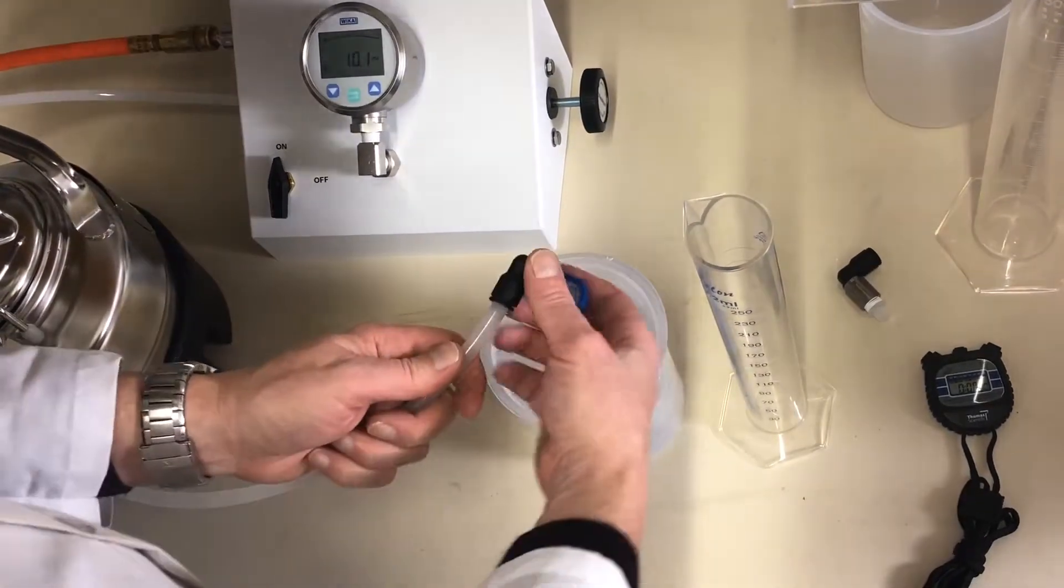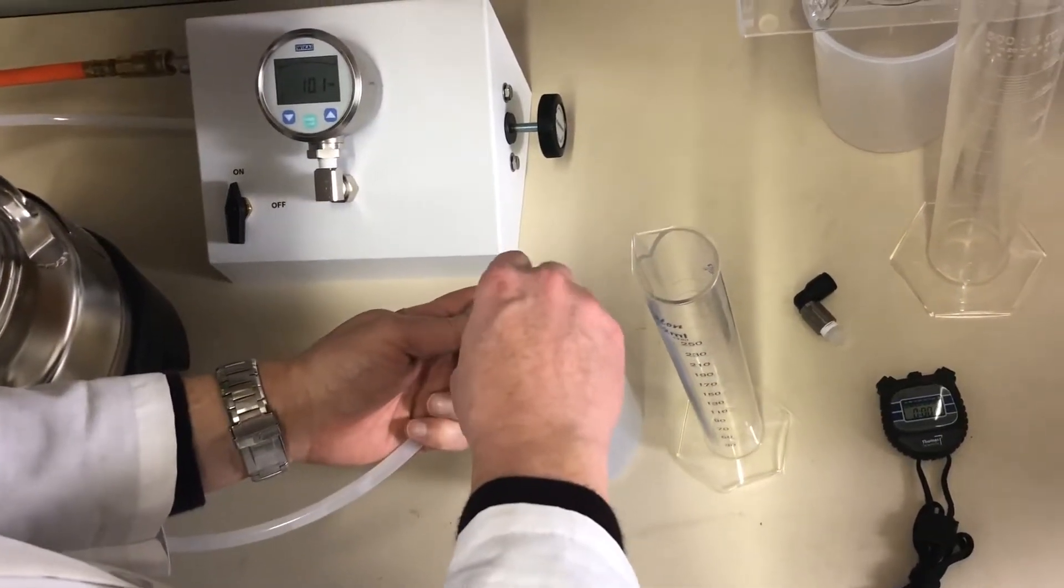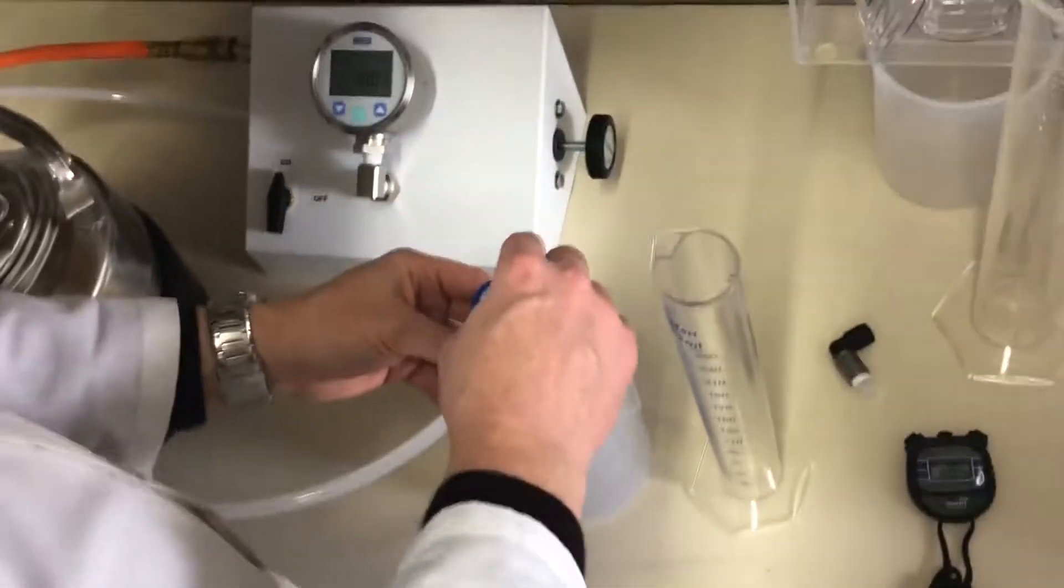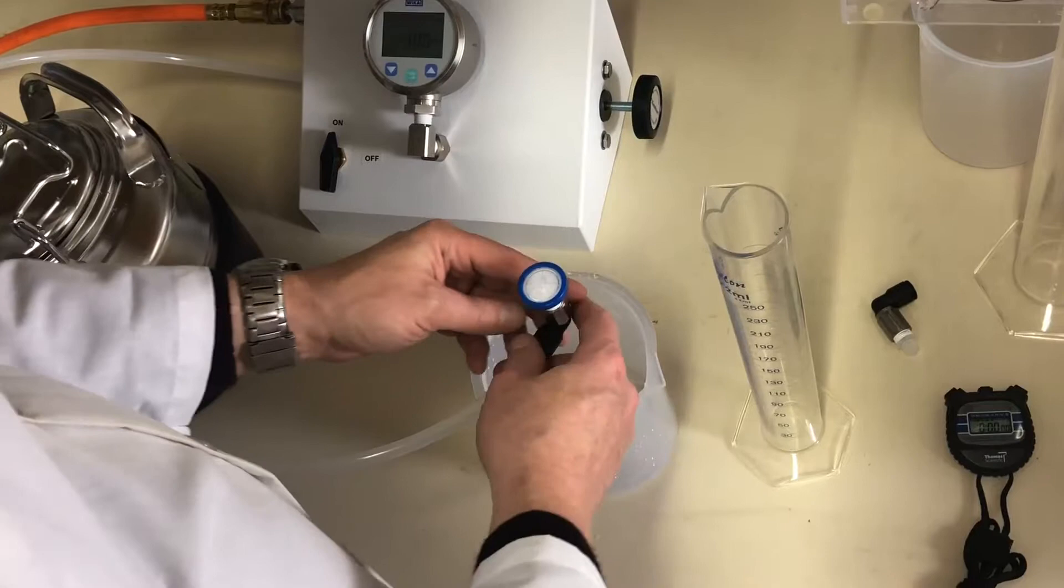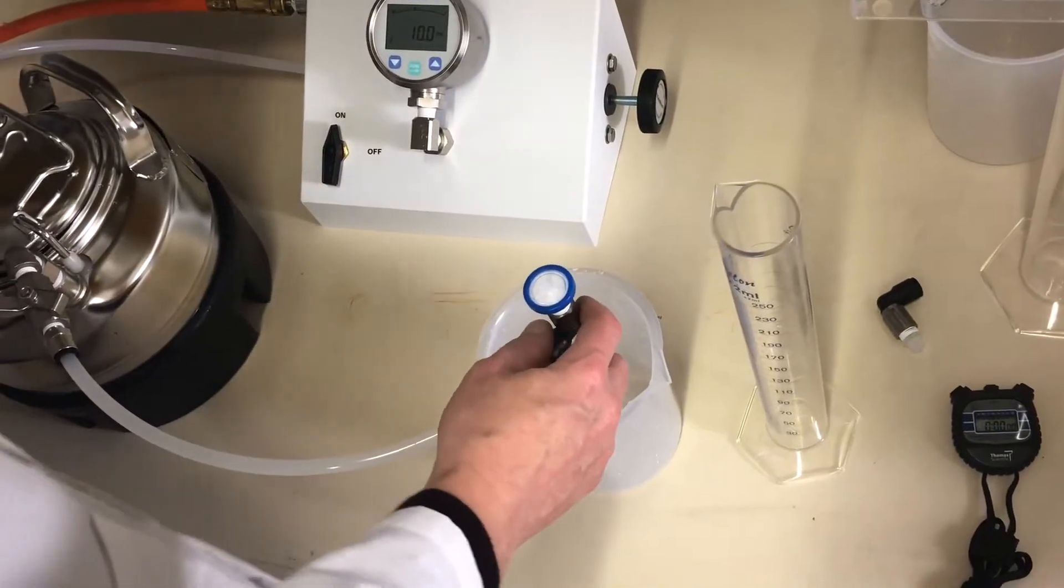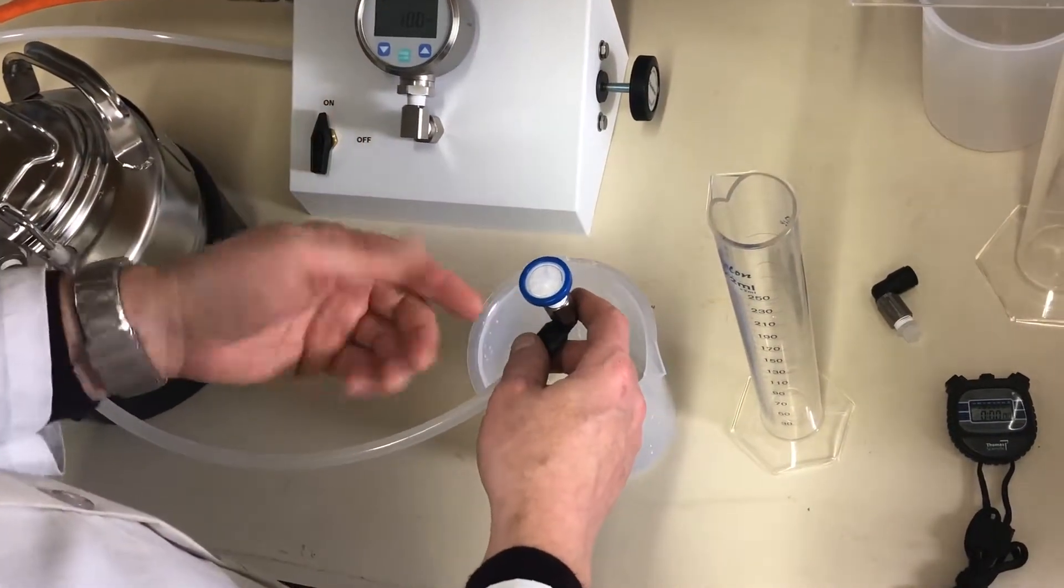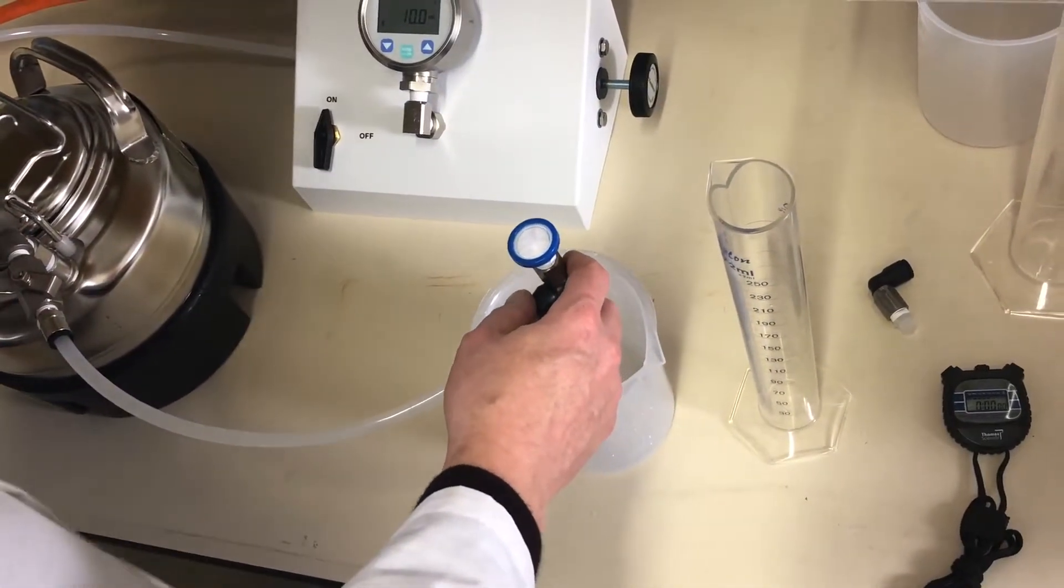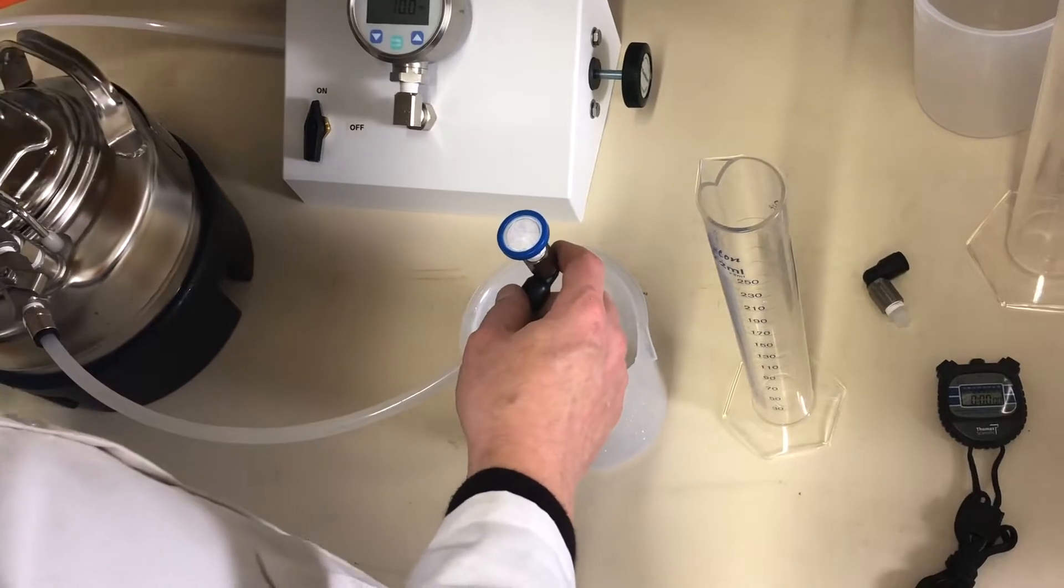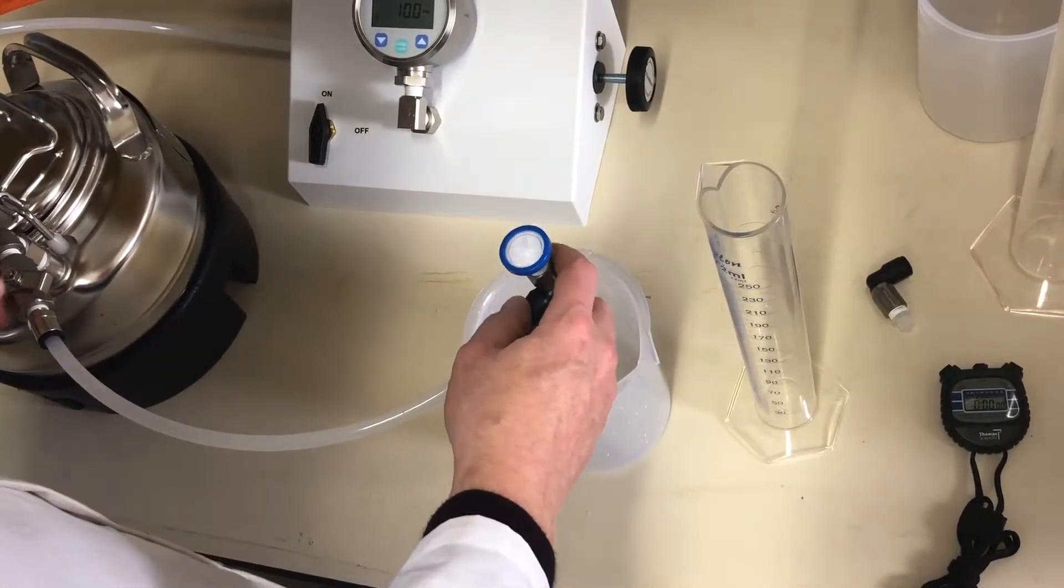It's nervous about being filmed. So we'll try again. While the filter is facing up, the idea is that if there's any air trapped in there, the air passes through first before the water encounters the membrane. We'll try again.